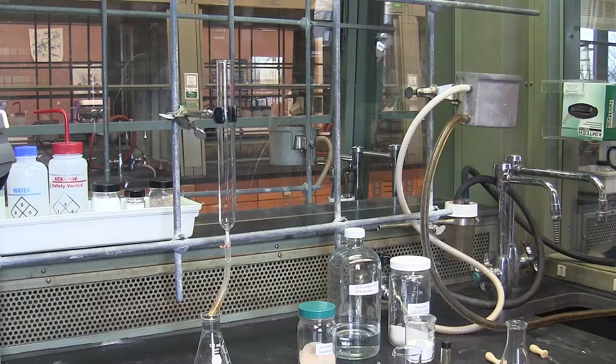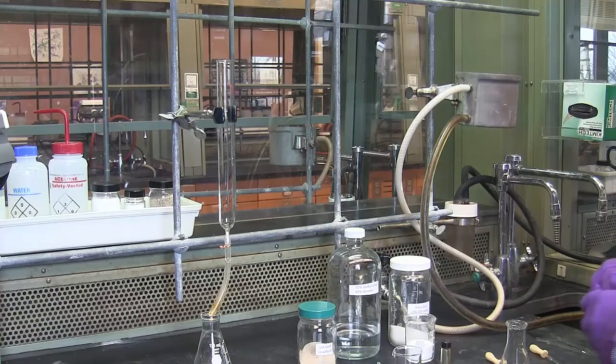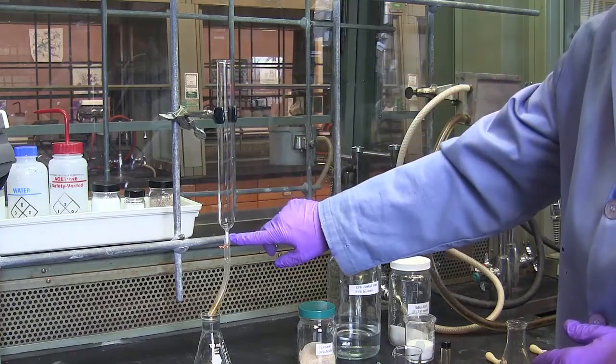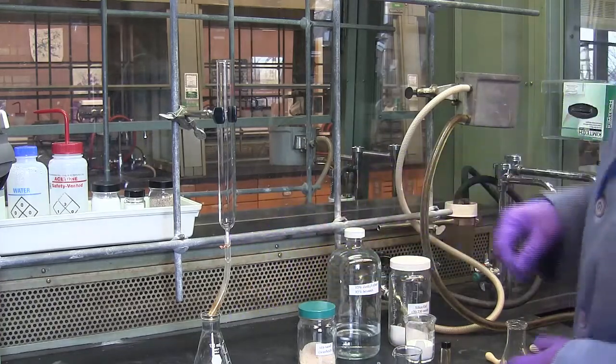Today I'd like to demonstrate how to wet pack a silica column. We have a column that has a little plug of cotton in the bottom and that leads to a collection flask.